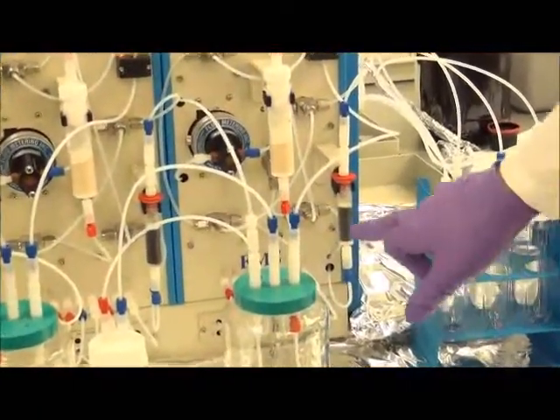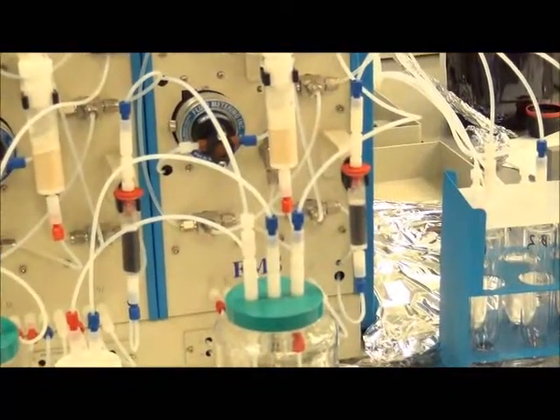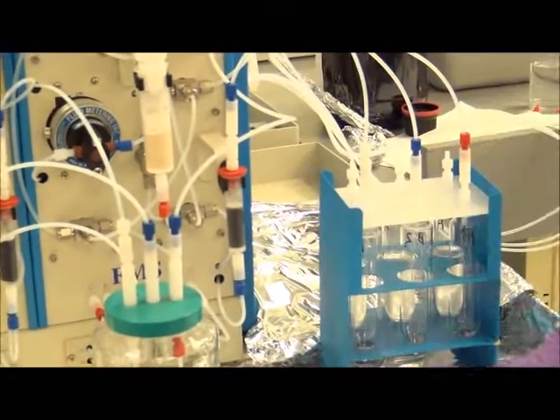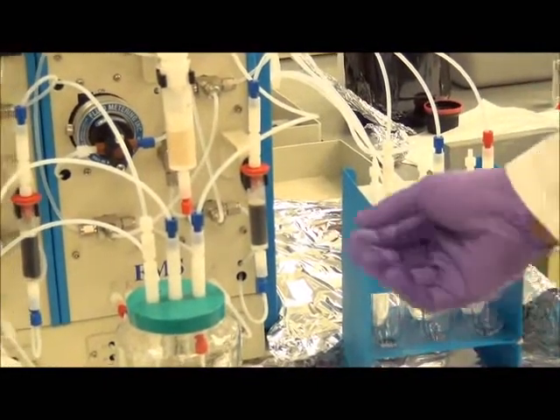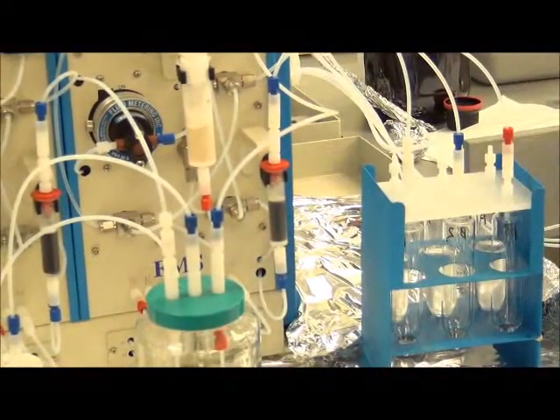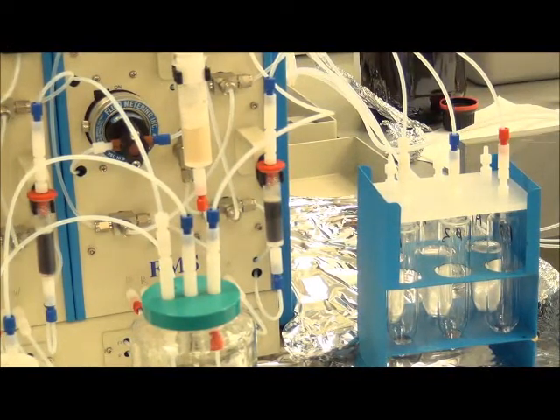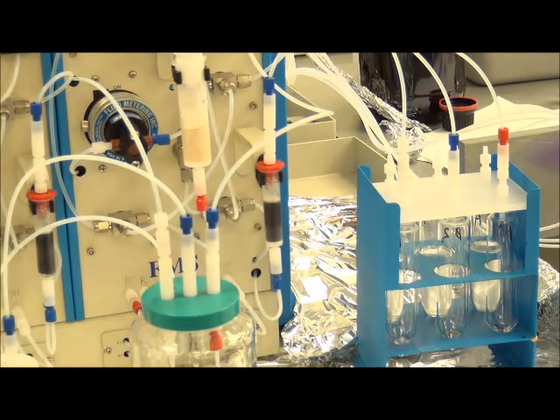It's going to elute first the coconut charcoal cartridge. This will be at a slightly slower flow rate, 5 mils a minute versus 10, just to increase the DCM contact time on the coconut charcoal to ensure that you get a good smooth elution of the analytes bound to it. You can see the methylene chloride working its way through and then collecting in the vial as it reaches full saturation.